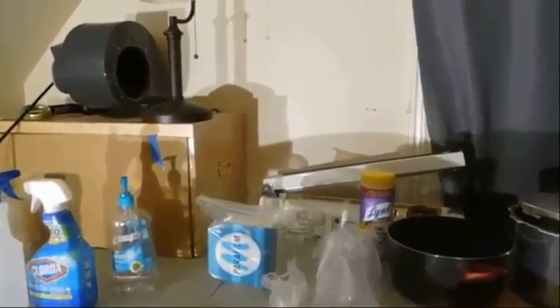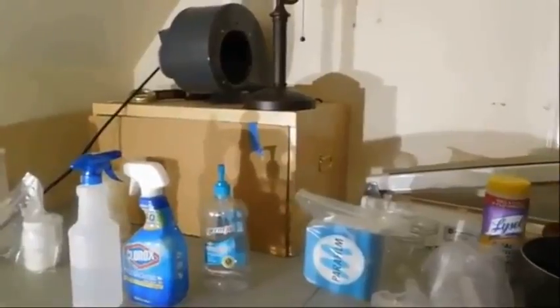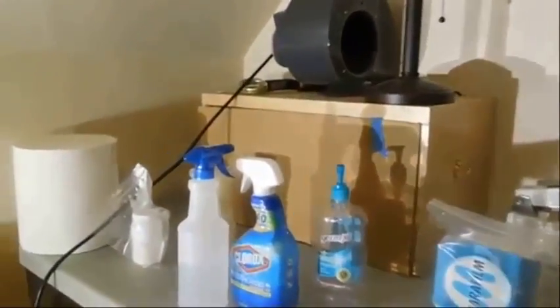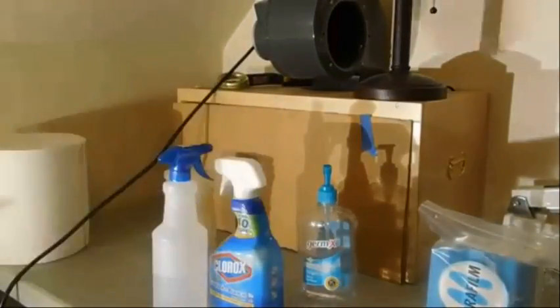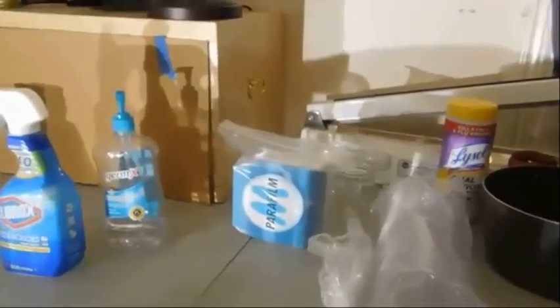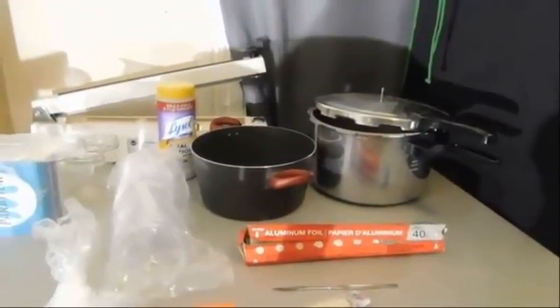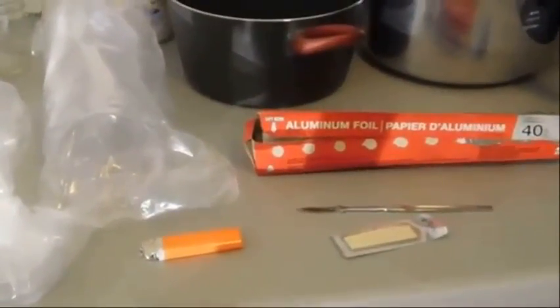Today I'm going to be teaching you how to make agar and transfers. This is basically everything you're going to need: all the items, the basic PDA, bleach, Germ-X, film to wrap, petri dishes, a pot to boil and bring to a simmer, a pressure cooker, and aluminum foil. You'll also need a flame source of some kind — either a lighter, alcohol lamp, or whatever.